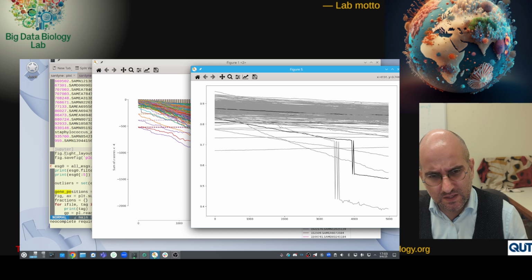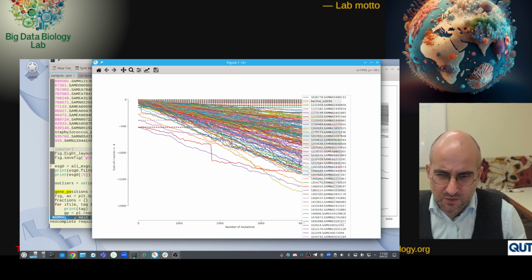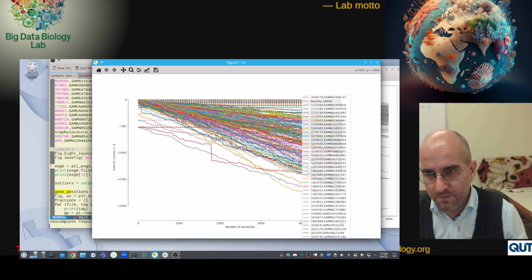there were these things that go up and down, and I had already noticed this drop here. These are 25 mutations added, and then suddenly there's a huge drop. The genome that's here and the genome that's there should be almost identical except for 25 base pairs. So what was going on here? I spent a bit of time looking at the genomes and the comparison, and it really didn't make sense that there was this big drop.